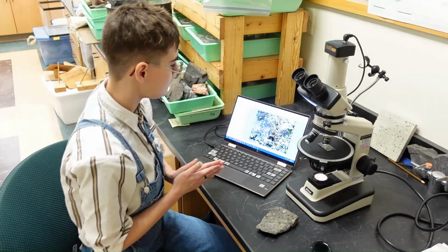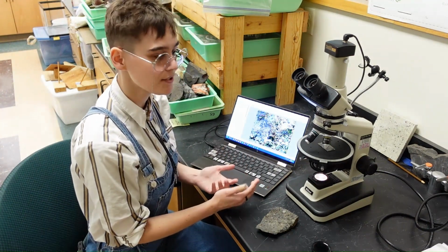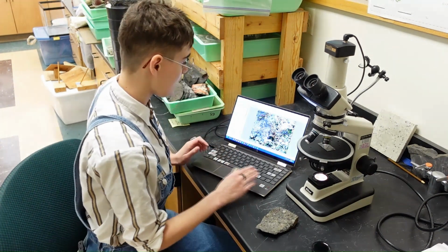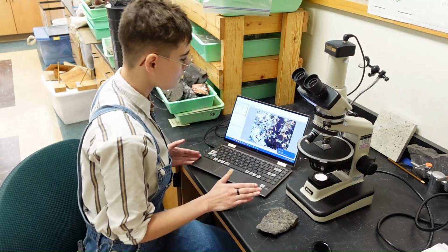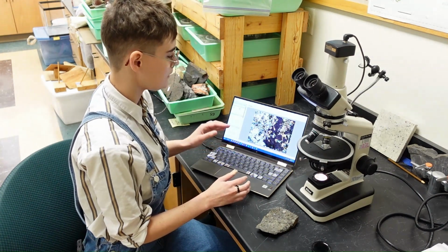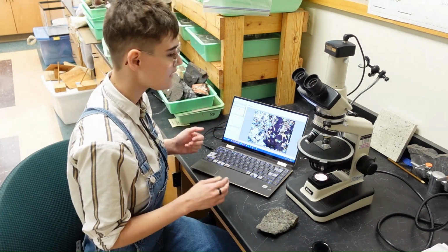that otherwise would block out the light. These polarizers are usually used for mineral identification by just different attributes. For example, if I can find some garnet, here's some garnet right here. Garnet is in total extinction here. It likes to completely block out any light that comes through it.